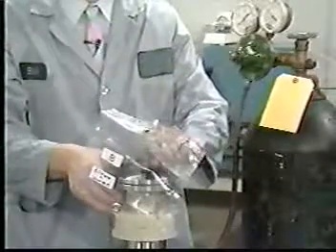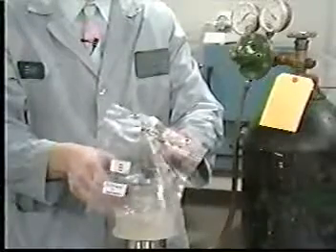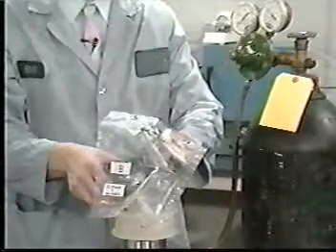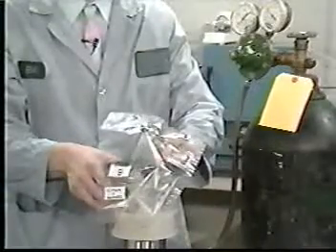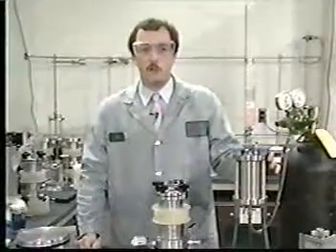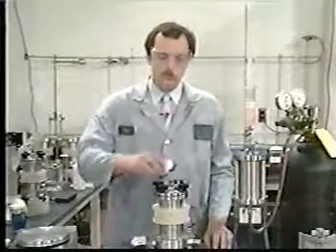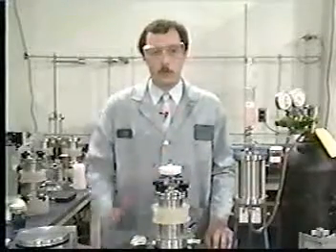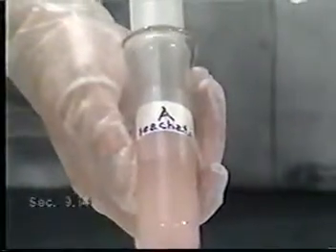The Tedlar bag, which already contains the initial filtrate of that waste, may also be used to collect the filtered leachate if there is sufficient volume. Regardless of which collection device is used, all of the liquid in the extractor should be filtered and collected. An inline glass fiber filter may be used if it is suspected that the filter in the ZHE has ruptured. The leachate is to be treated as follows.